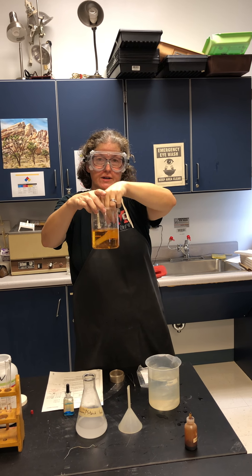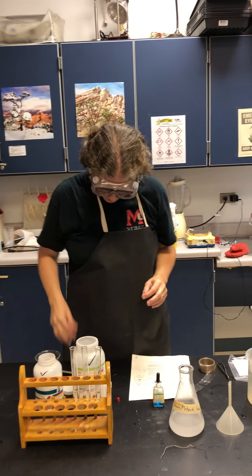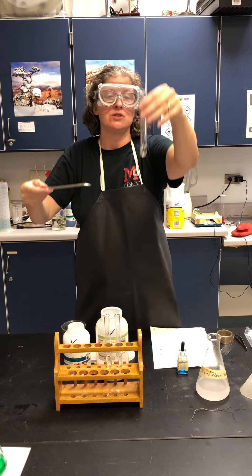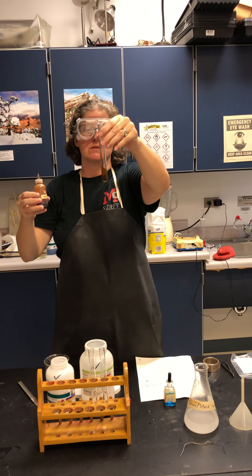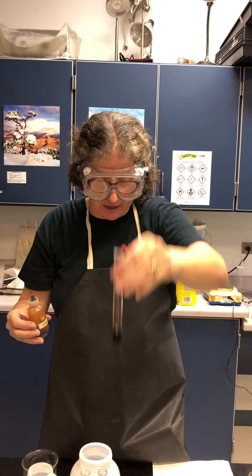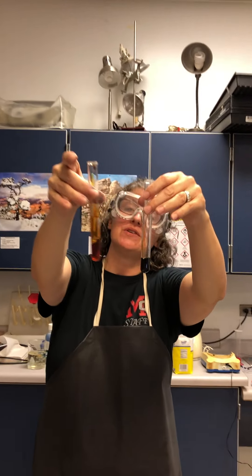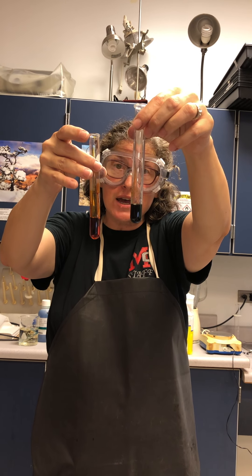Let me show you what happens if iodine comes in contact with starch. I'll take a little starch, put it into a test tube with water, and add iodine. When iodine comes in contact with starch, you can see it turns very, very dark — almost black. That is a positive test for starch; the iodine is the indicator chemical. Without starch, it stays a golden, clear color — that's a negative test.